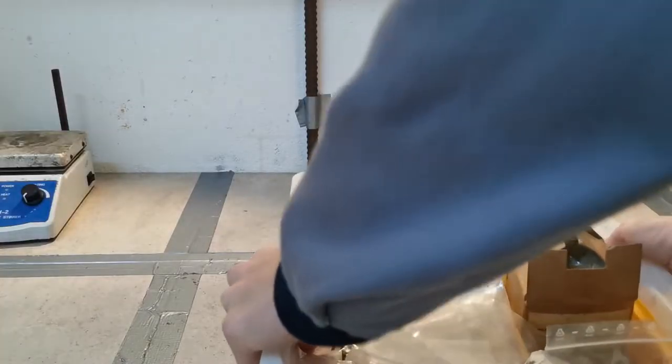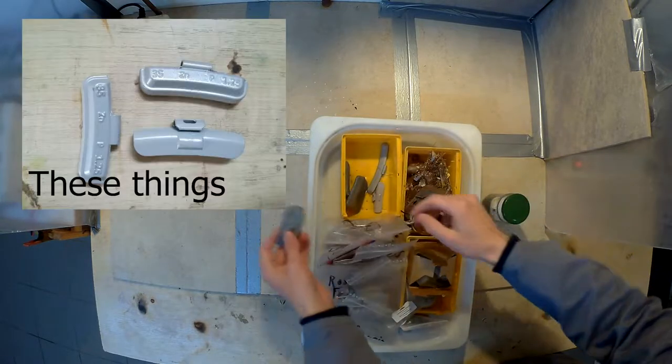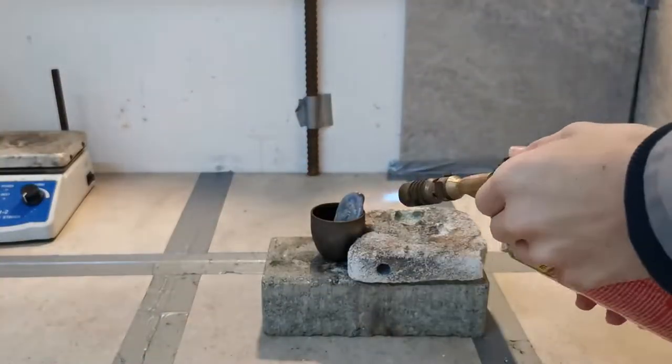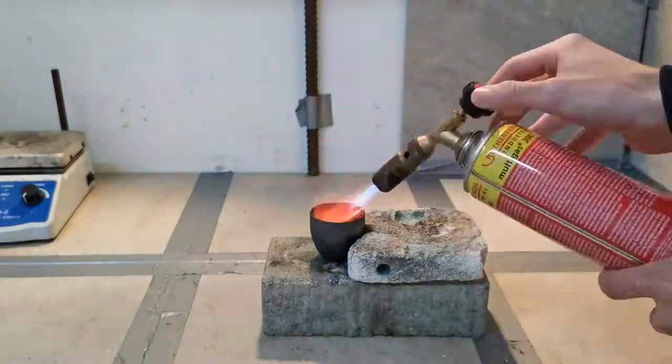So to get started, I got myself a piece of zinc metal from some old tire weights I had molten down. This was pretty dirty though, so I decided to remelt it and make some sponge. Which is actually going to increase the surface area, therefore making it easier to dissolve later.